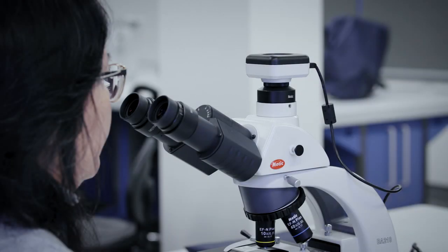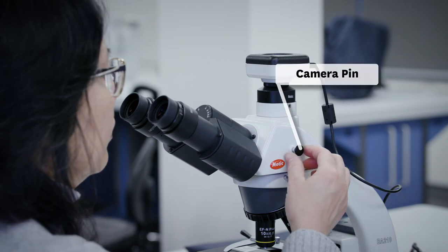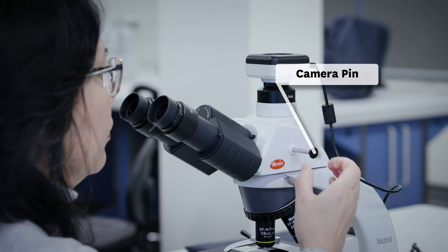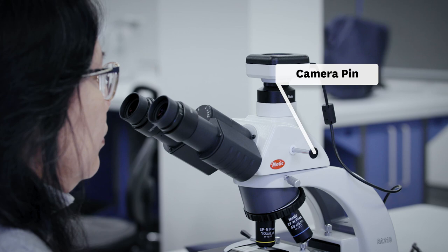Cameras are installed on our microscopes. If you want to bring the image to the camera, pull the camera pin out. Part of the light will go to the camera.